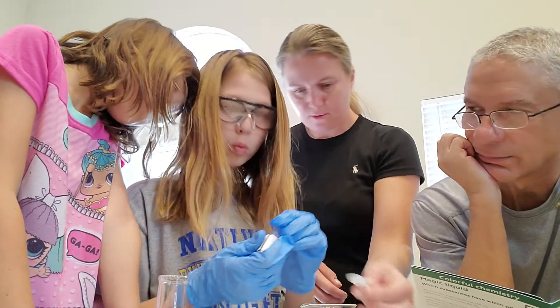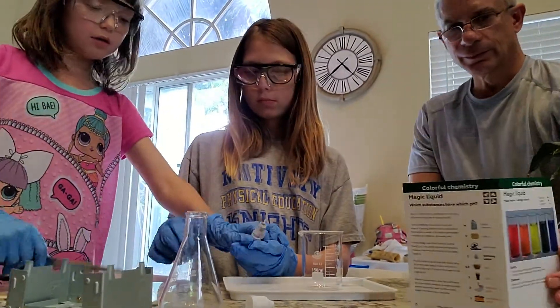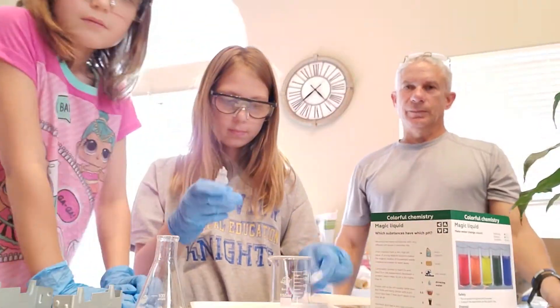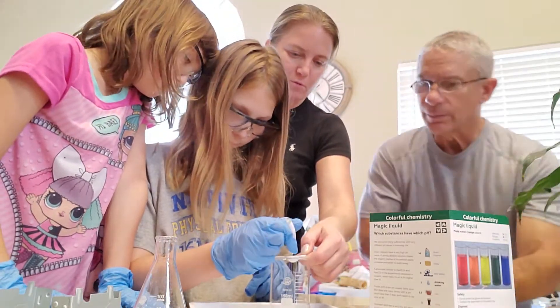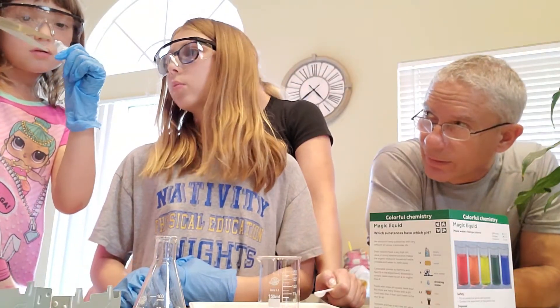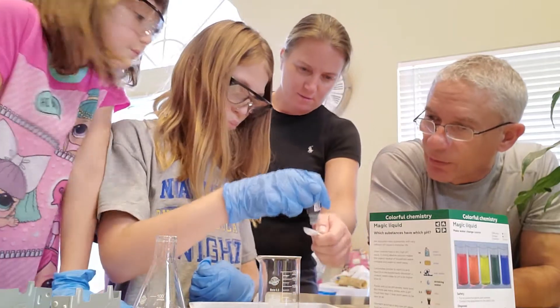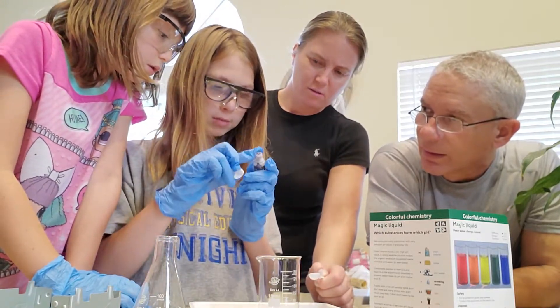You need scissors. Okay, you need scissors. And then we need water. I'm going to cut it. Cut it off. Try now. Mom, hold the cup. Hold the spoon. Spoon of water — you give me a job to do. You cut it good? One more. All the way? Are you supposed to poke something in there? Just open it, just cut it. There's something blocking it. I think you're supposed to poke something in there. The board is blocking it. Do you have like a pin or something? Maybe this part is going to come off — it's supposed to come off.